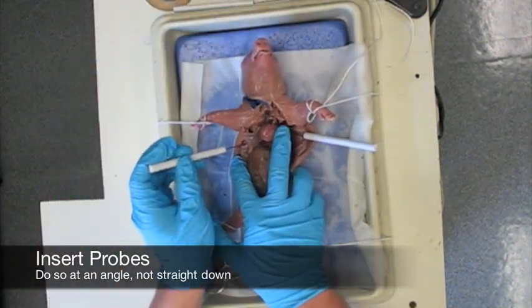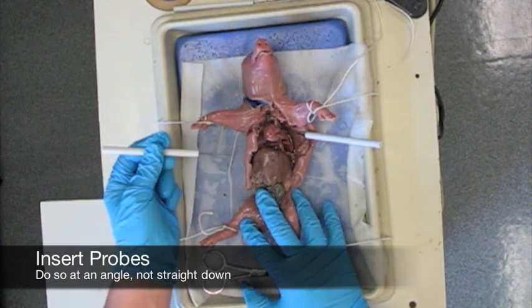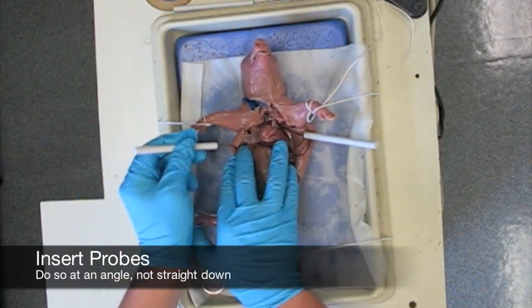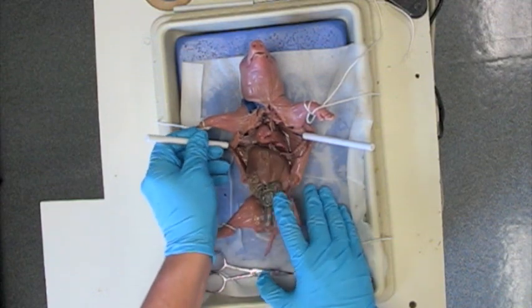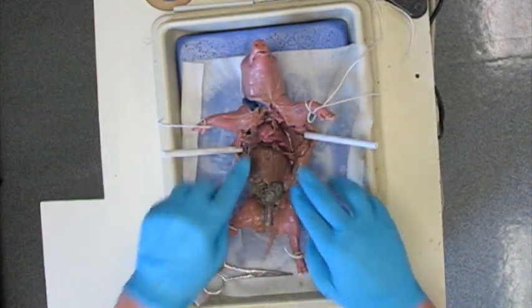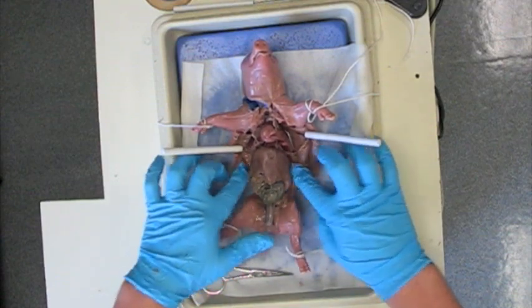When you place a probe or a pin into a dissecting tray, it is never a good idea to go straight down, but a better idea to go at an angle. That way it pulls back more tissue, uses less tension, and you can actually see a heck of a lot more. Start pushing the tissue around and if it tears with your fingers, that is okay.